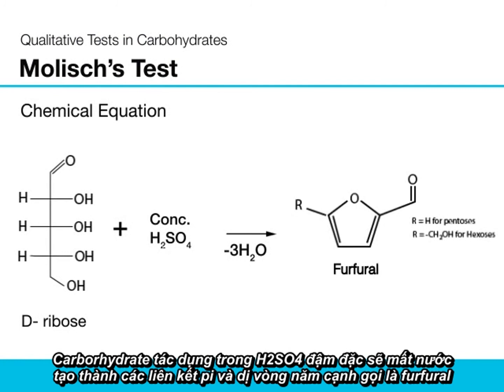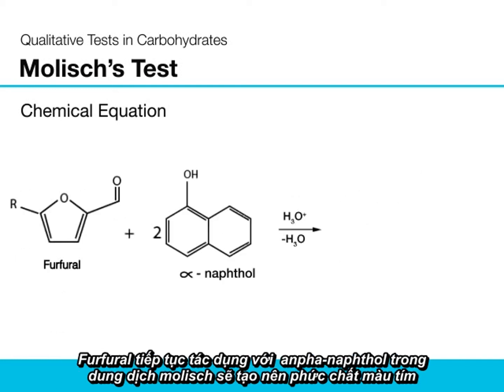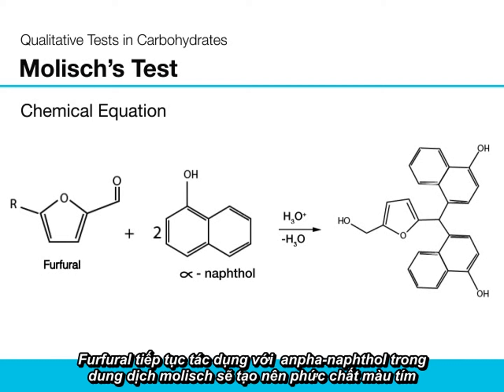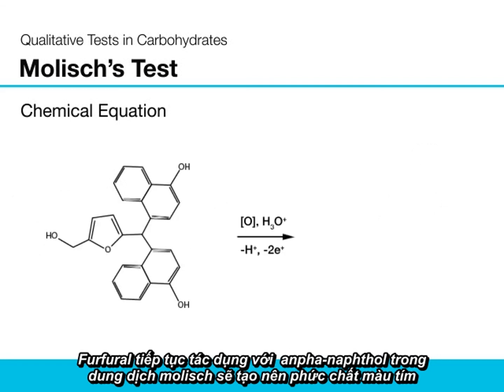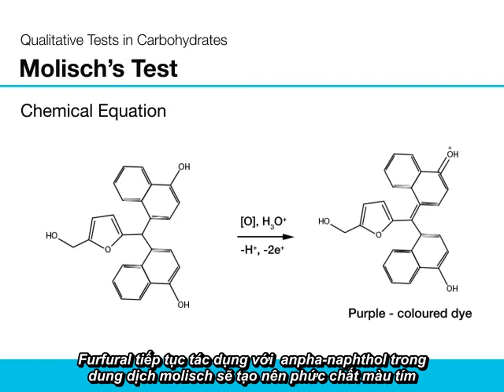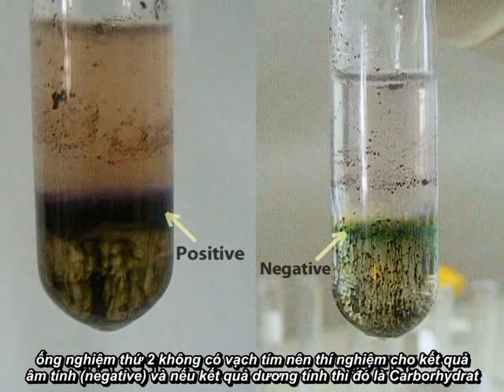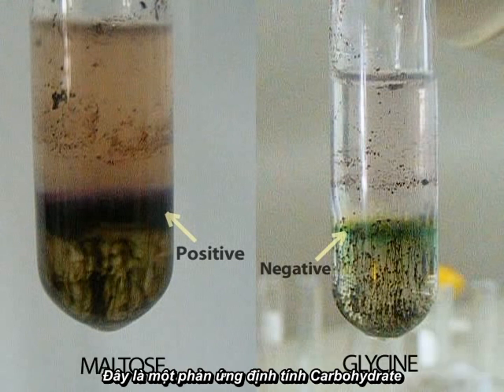Carbohydrates dehydrate in the presence of concentrated sulfuric acid to yield furfurals or furfural derivatives. Furfurals or their derivatives react with alpha-naphthol in Molisch reagent to yield the purple colored complex molecule, seen as the positive result. Although this test will detect compounds other than carbohydrates such as glycoproteins, a negative result will indicate the absence of carbohydrates.